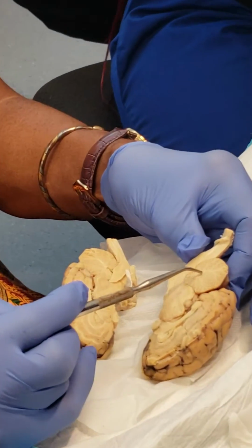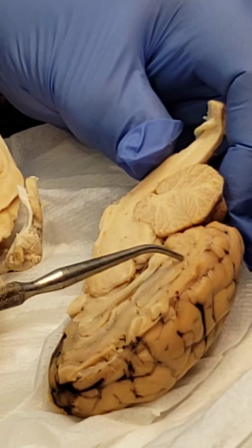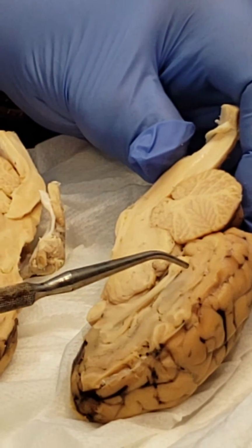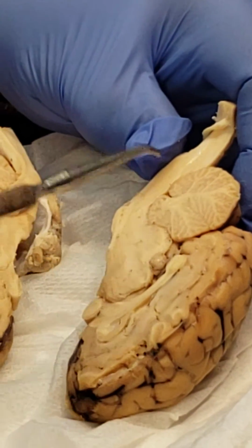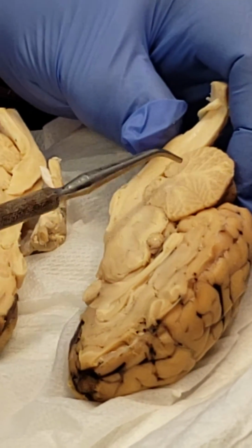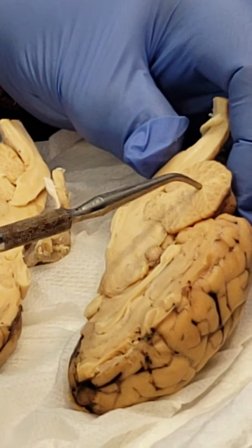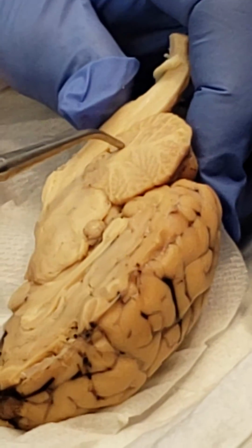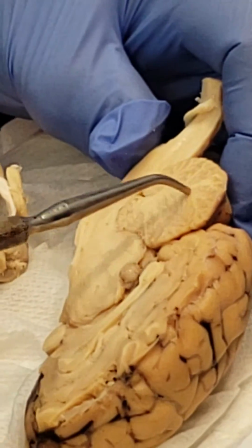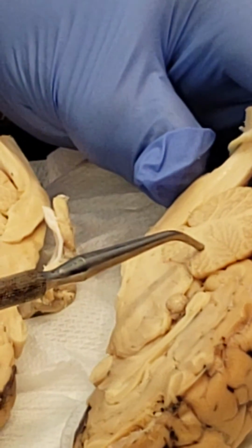So this white represents myelinated nerves. Myelinated nerves in the central nervous system are created by oligodendrocytes, which are also glial cells. I'm saying this because this was in the first packet that you did. Oligodendrocytes create the covering on neurons, and these myelinated nerves can transmit an electrical current 100 times faster than the unmyelinated nerves, which make up the cortex.